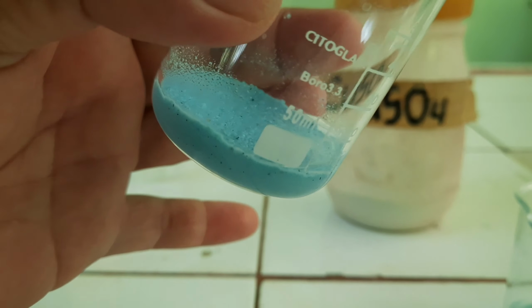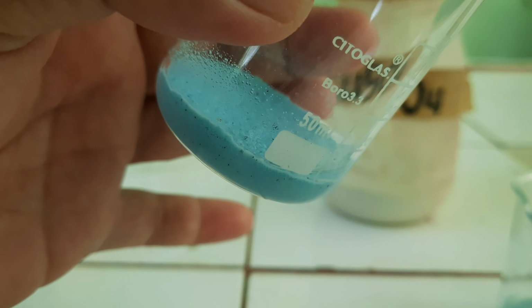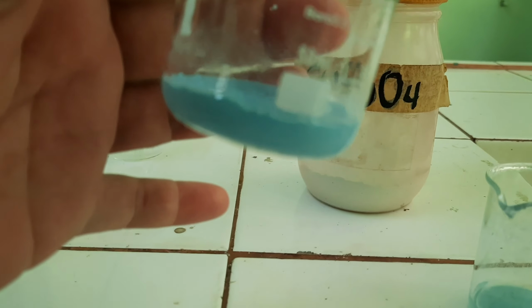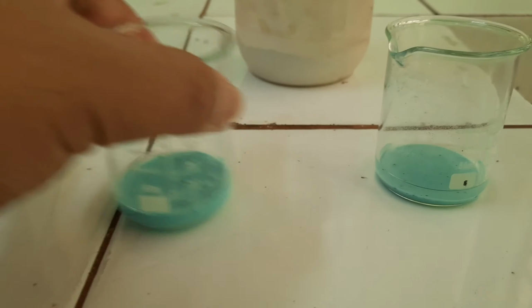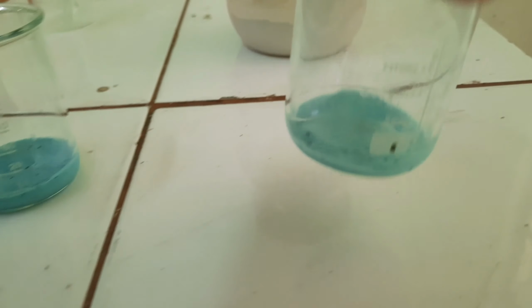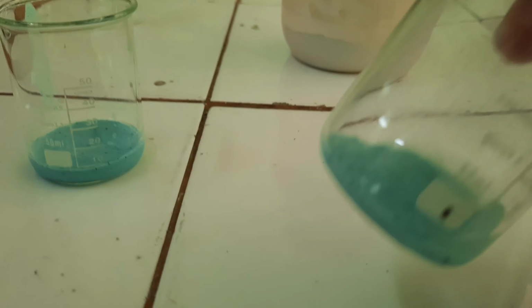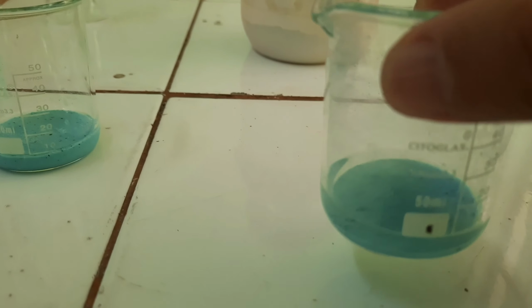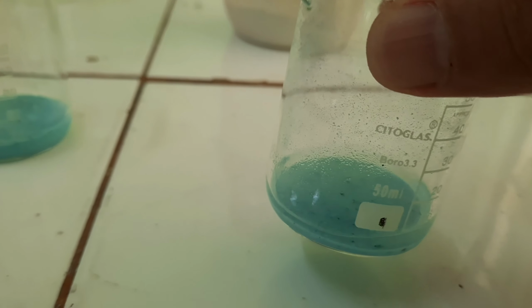While the rest of the copper sulfate added turned blue, the liquid volume of the alcohol solution is now reduced to this little amount, considering that most of the water had been absorbed by the copper sulfate. While in a more concentrated alcohol solution, the copper sulfate also turned blue, absorbing water.